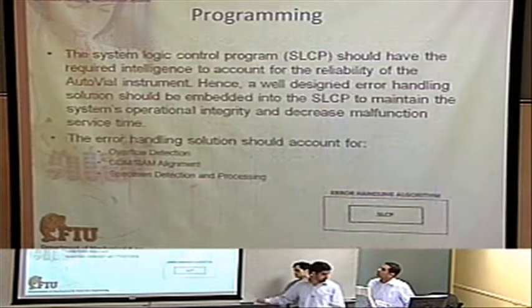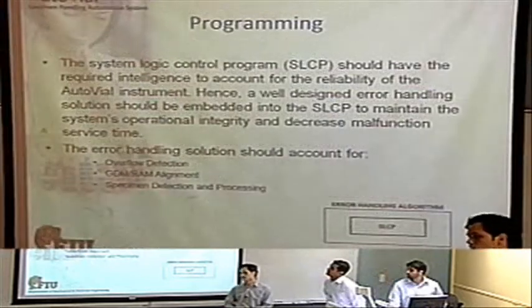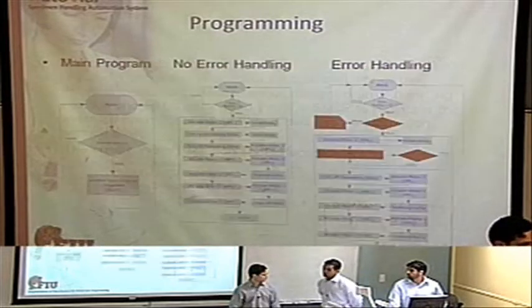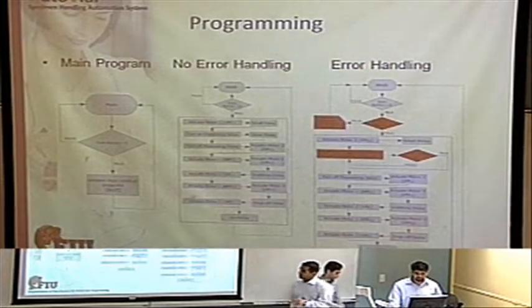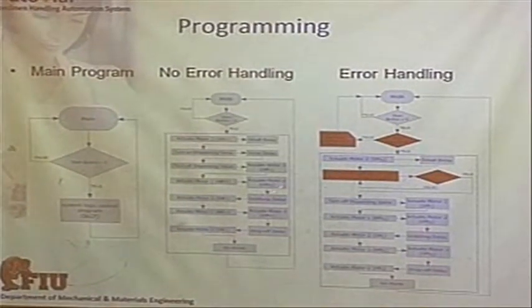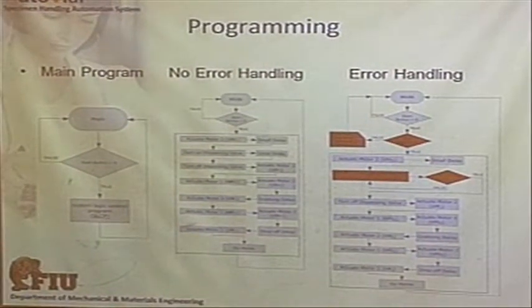Next, the VDM and any other error handling that we need. In the case of mass production, we would have to have a better program. That's why error handling comes in handy here. This is an example of our actual algorithm without error handling, and then this is the flow chart.